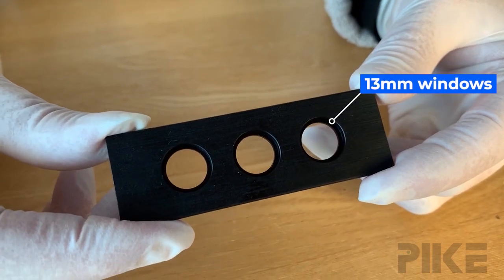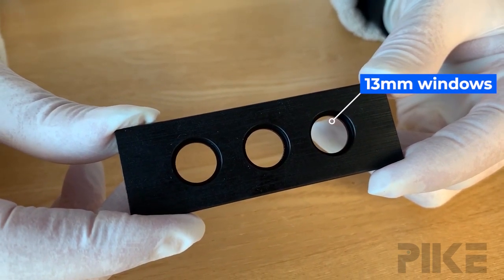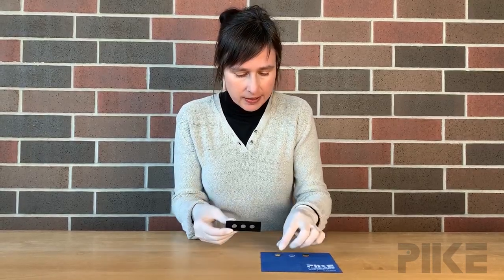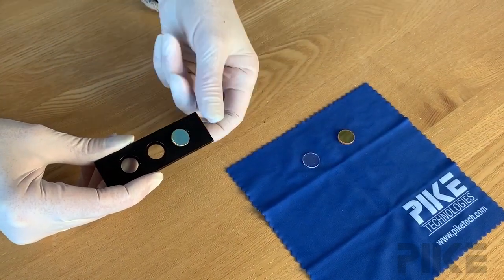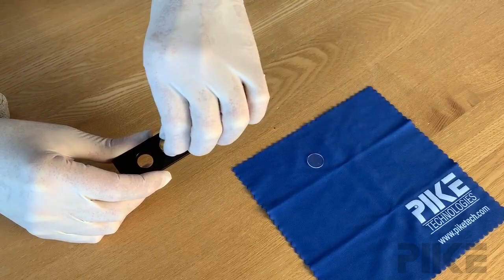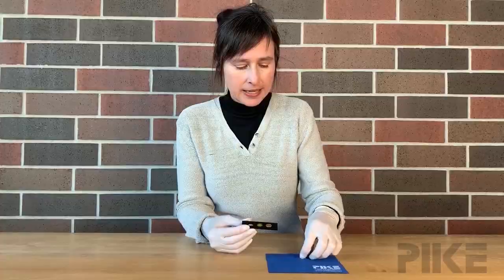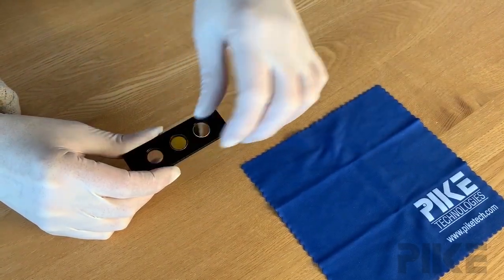It's got a dimension of one inch by three inches and fits most FTIR microscope stages. With this slide, we can put a mirror in one position for reflection. If we want to do transmission measurements, we can insert a window — that was a zinc selenide. Here's a KBr window. And it's that simple.